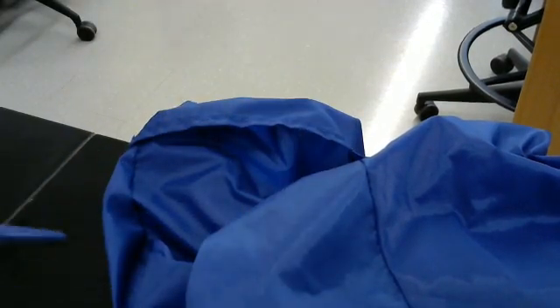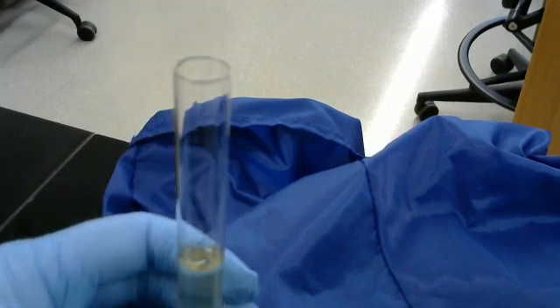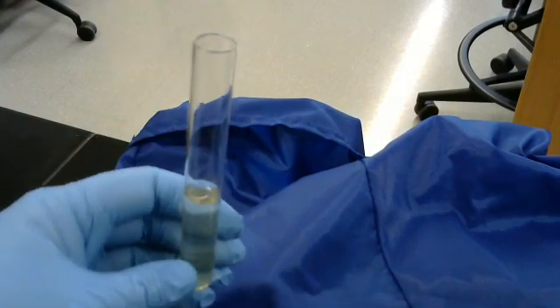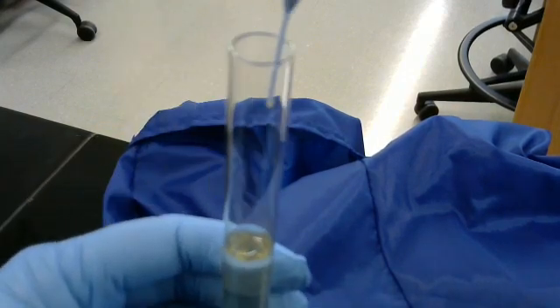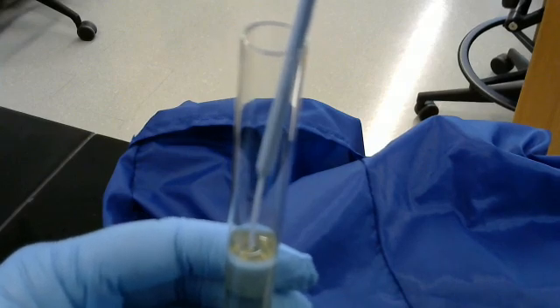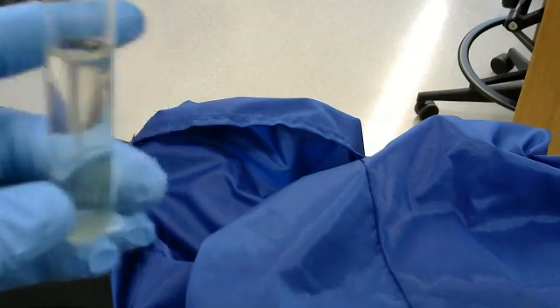Here's our tube. Same as before, go in, down, and up. Right like that. That's a stab.